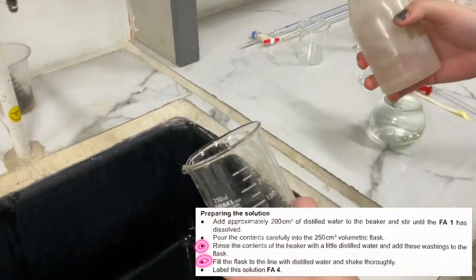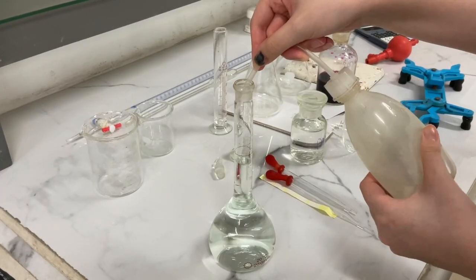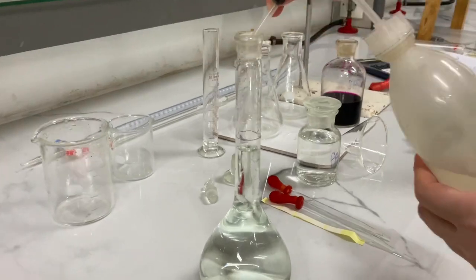Then, rinse the contents of the beaker with a little distilled water and fill the flask to the line with it along with more distilled water, and shake thoroughly.